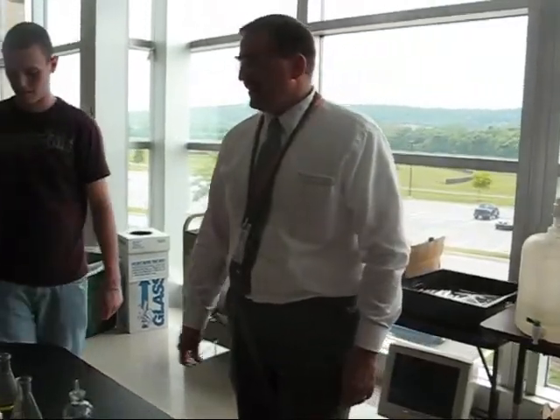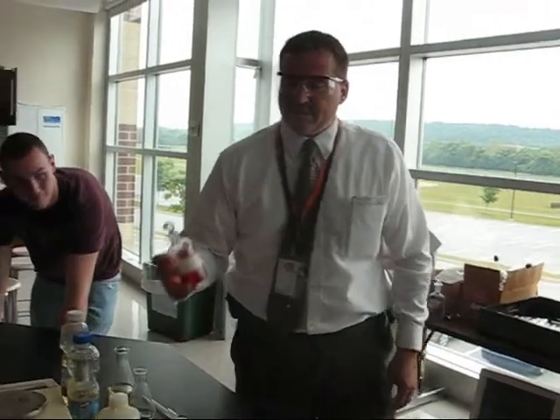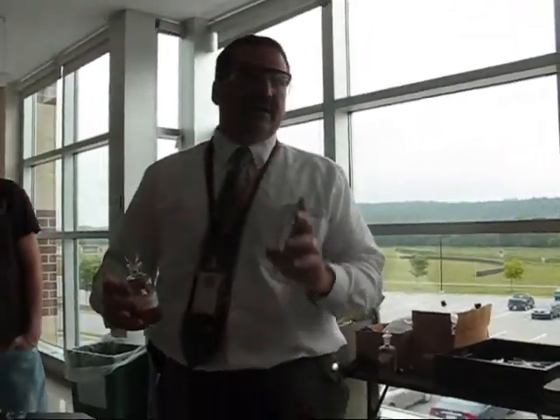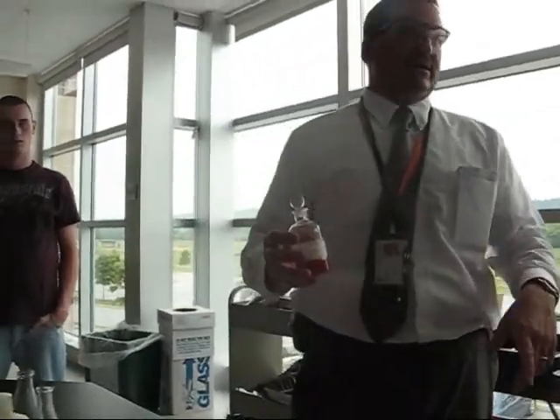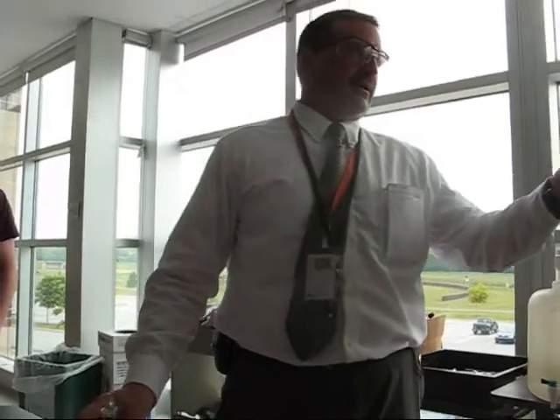Let's go over there a little bit. Okay. What this stuff is, this is the element bromine. The element bromine, which is in the what column of the periodic table? 7 or 17. It's called one of the halogens.